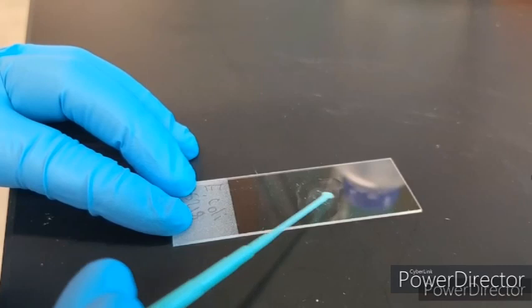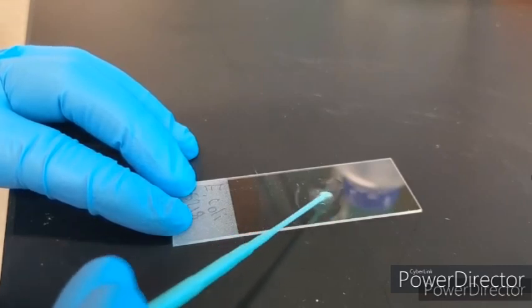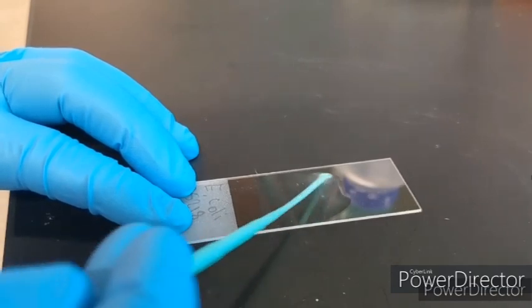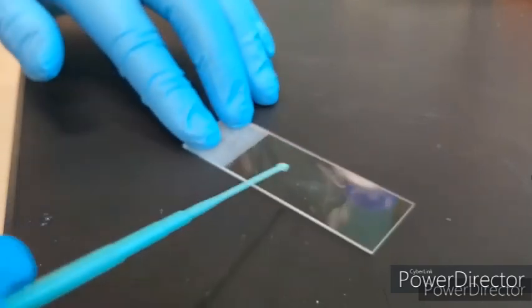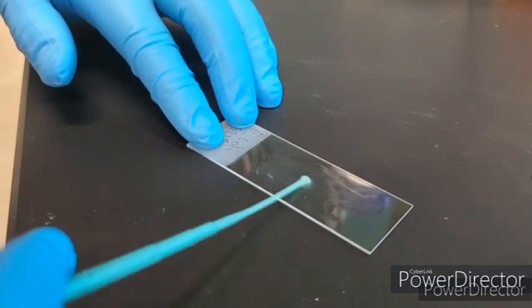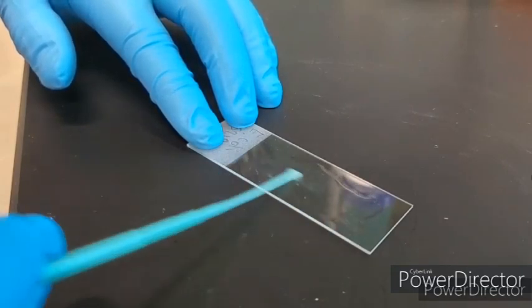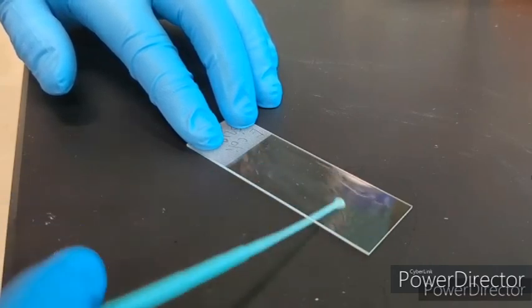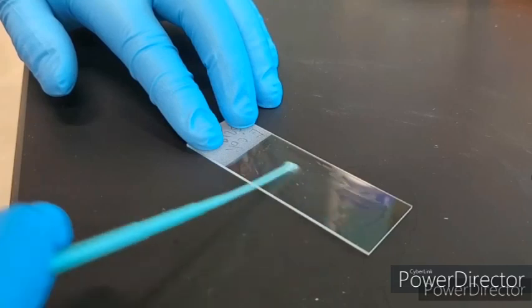And then stirring it faster than this could cause breaking of the arrangement of cells if you stir and mix with the water faster than this speed. So you've got to be careful with how fast you're mixing organisms too.